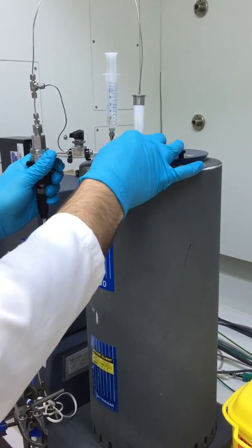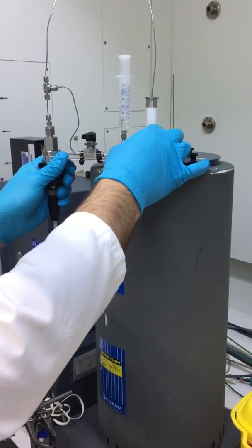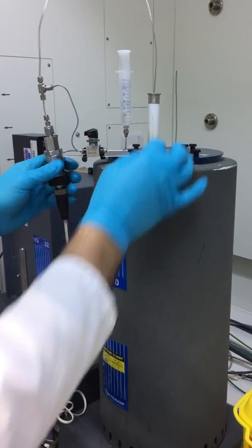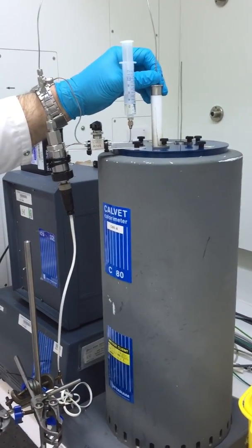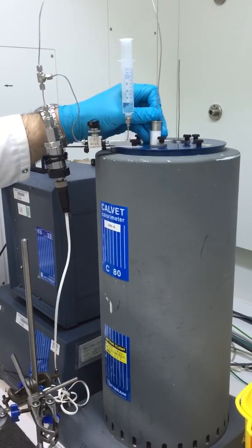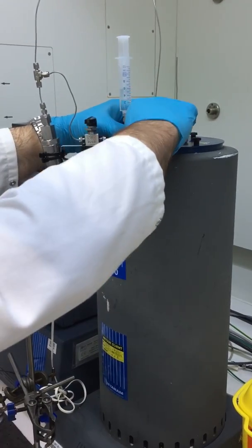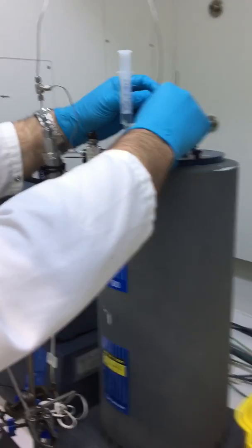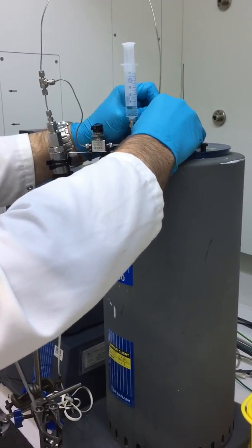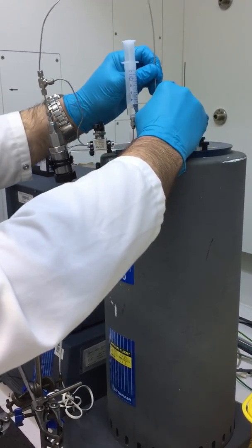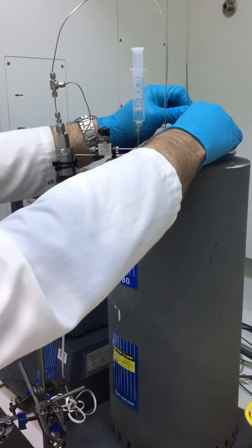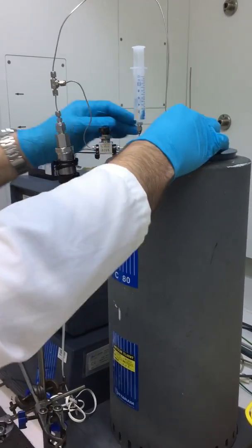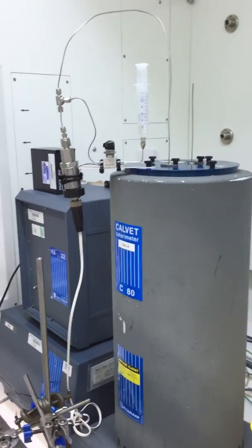We then remove one of the lid fastening nuts and place that through the hole in the transducer holder so it's secured for the duration of the run. We then lower the spacer and the sample down to the bottom of the C80 and start our run on the machine.